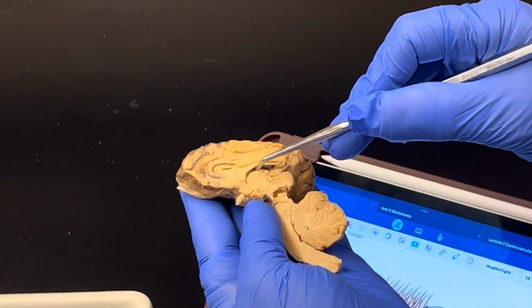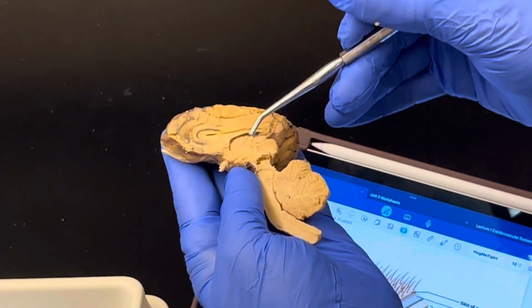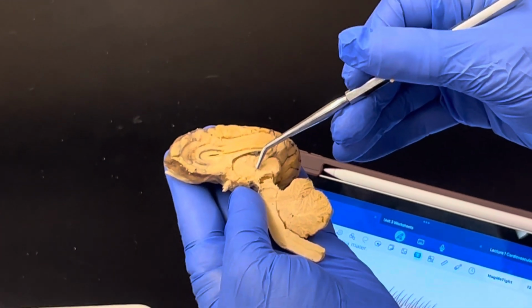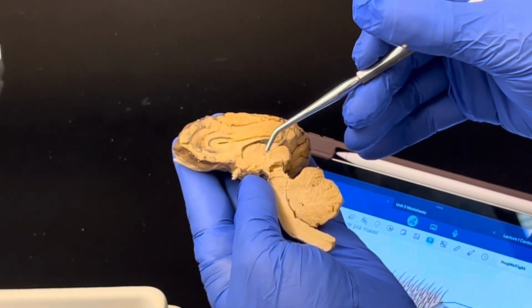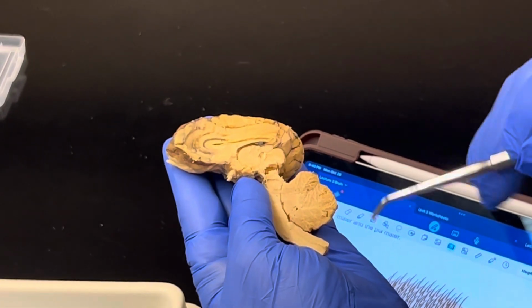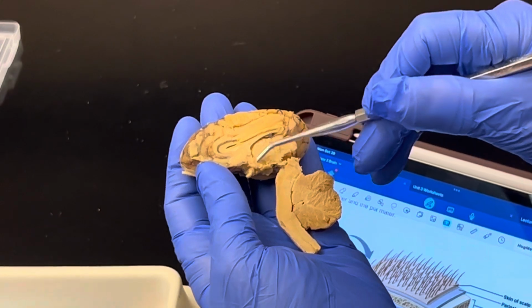The third ventricle not only goes around the outside of the thalamus, it also travels in between the two hemispheres of the thalamus. The thalamus also has a structure that connects both hemispheres known as the interthalamic adhesion. That interthalamic adhesion allows for information to be passed through both hemispheres of the thalamus. As you may or may not remember, the thalamus is the main switchboard for all incoming and outgoing signals. Then right below the thalamus is this region known as the hypothalamus.